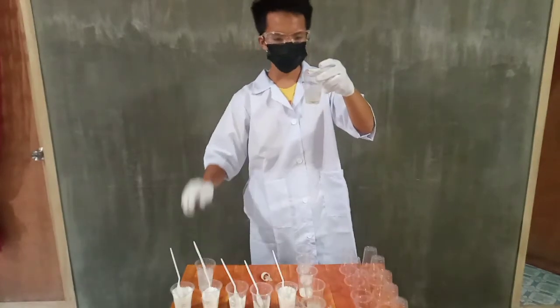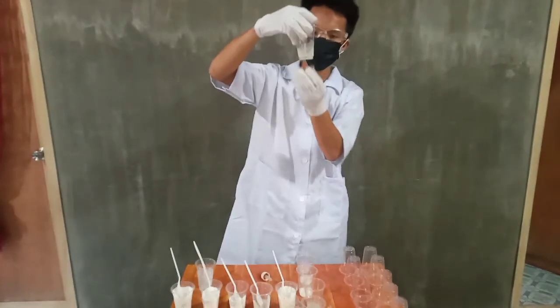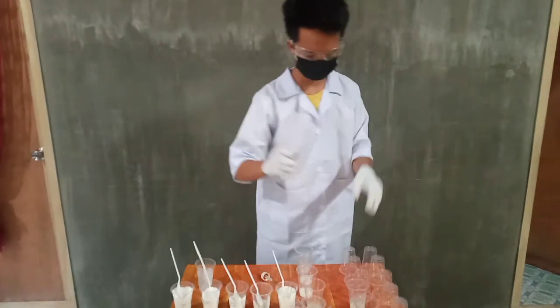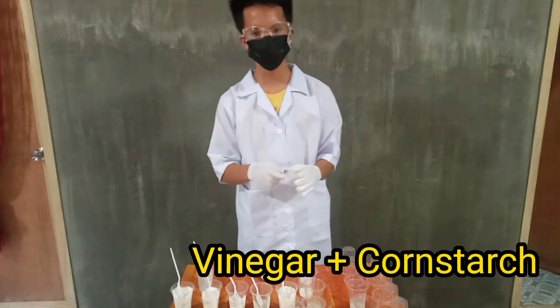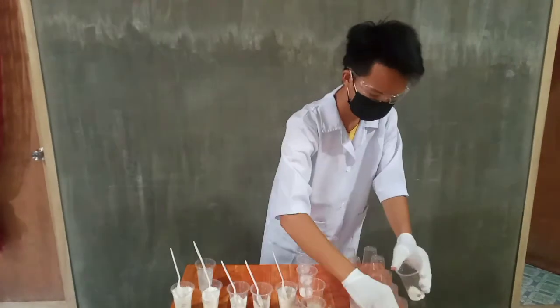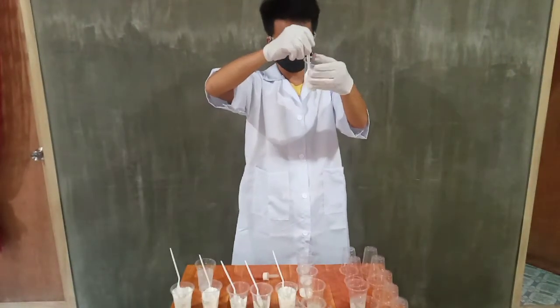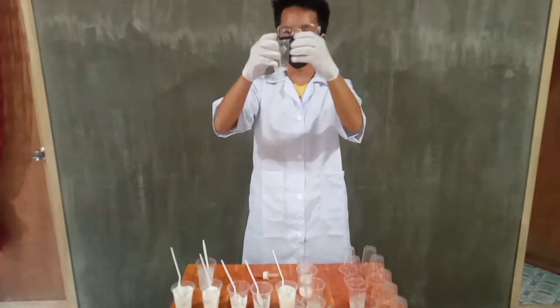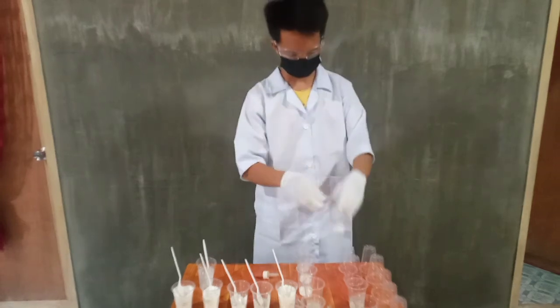In this mixture, chalk can dissolve in the vinegar, and there is a light gray color formed. The next one is the mixture of cornstarch and vinegar. The cornstarch dissolved in the vinegar and a white color formed.